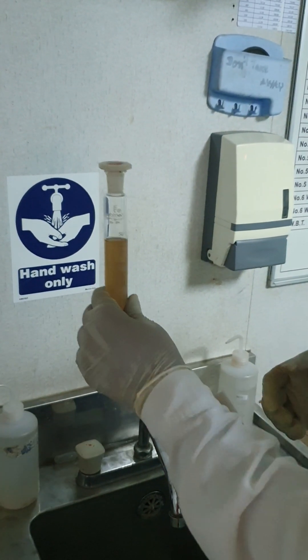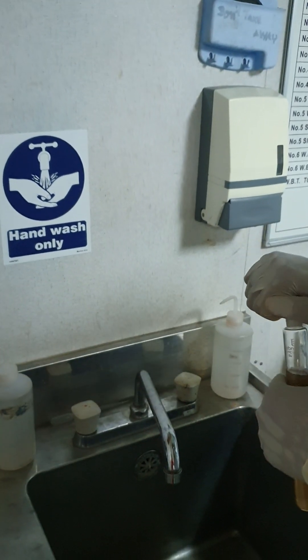You can take all in the refrigerator and you can compare which one is changing the color first. That means that one you need to be more careful. This is how we do the PTT test on board. Okay.